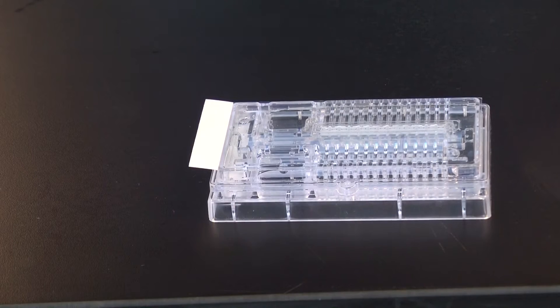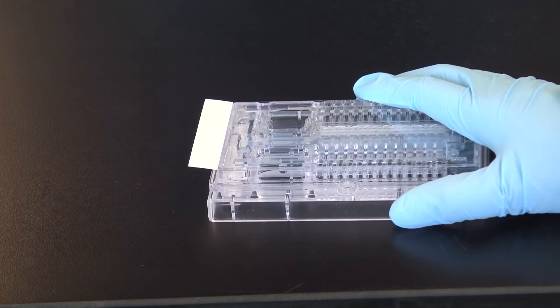Place the cassette on a flat bench surface. Hold down firmly and peel off the tape.